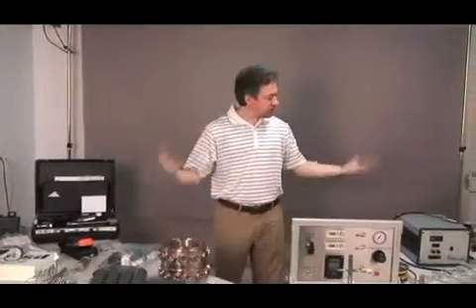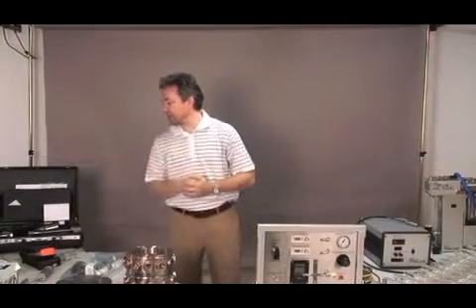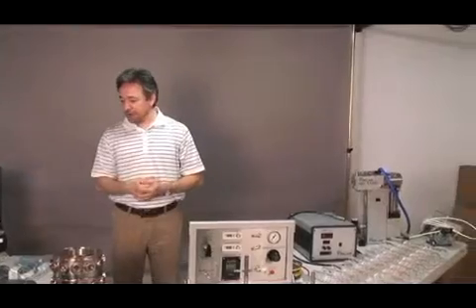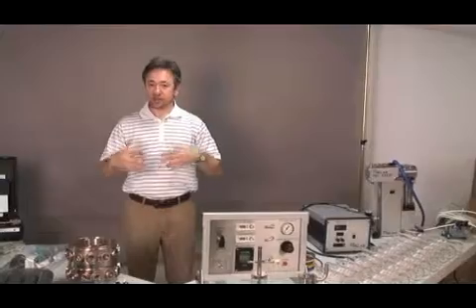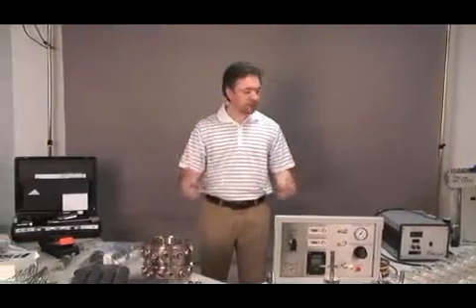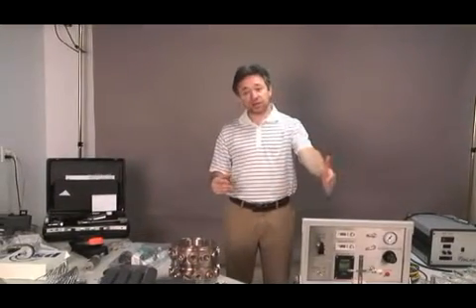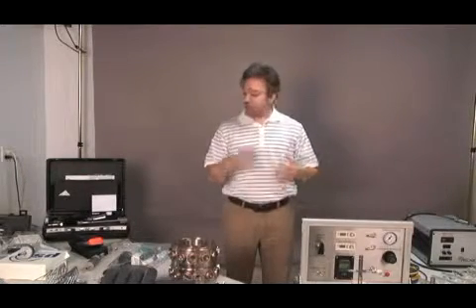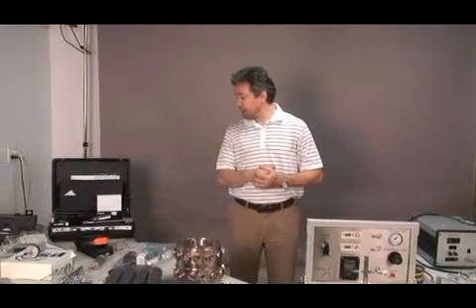In a few words, this was a description of each different item of the system. Now we're going to focus on the sequence of how you assemble the system, and then after assembling the system, we are going to demonstrate how the generators are used with the system, what procedures you should follow to operate it, as well as the sampling devices and checking the flows of the system.